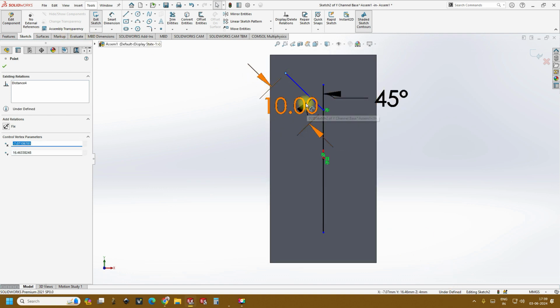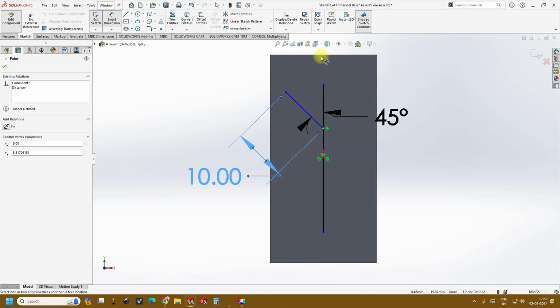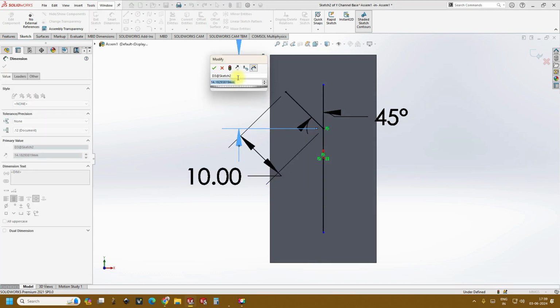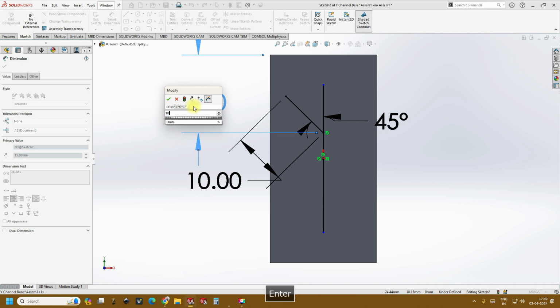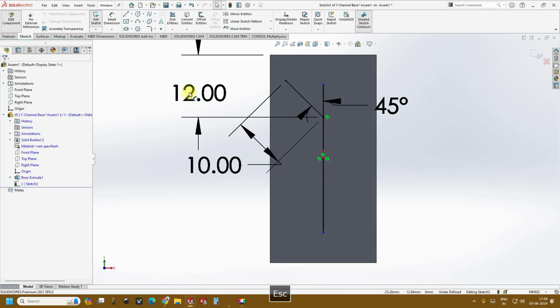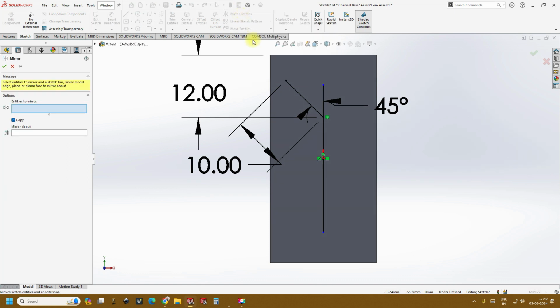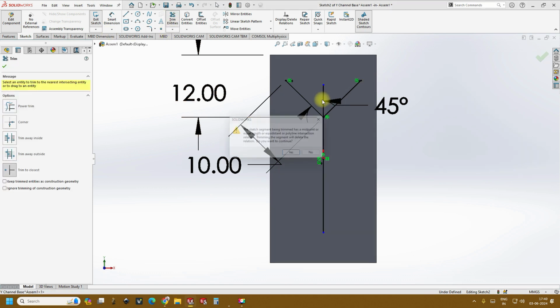So now just press Ctrl Z, and we are sure that it is moving since there is no constraint between this point and this. So assuming this to be 15 mm, or you can keep it as 10 mm. Okay, let's keep it somewhere around 12. Okay, and then same thing you can do, or you go to mirror entities, select the entities that you want to mirror, and create a copy about this line, and followed by you can trim this portion.